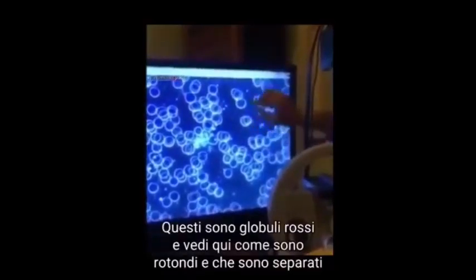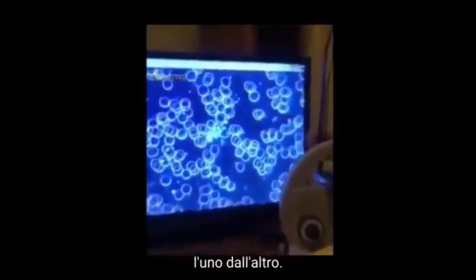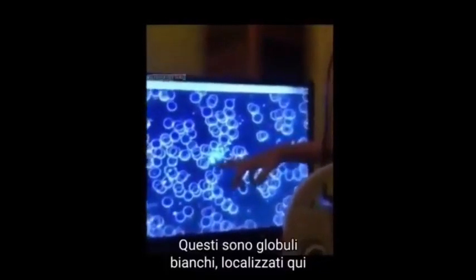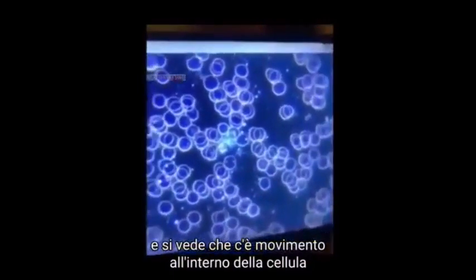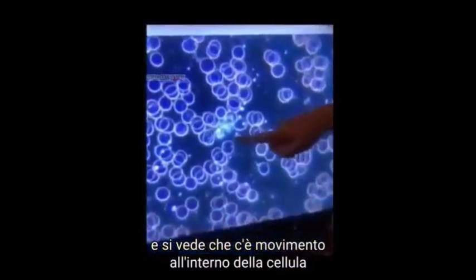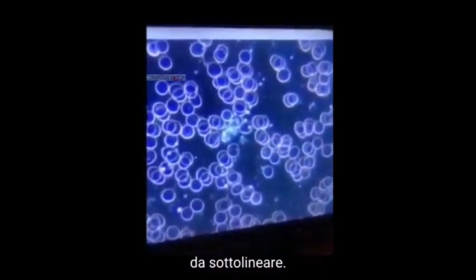These are our red blood cells, and we're aiming here that they're really round and separated, so one by one. These are the white blood cells, the leukocytes, and you can actually also see there is movement in the cell, which is really important, that they're active. Yeah, so this is important to see.